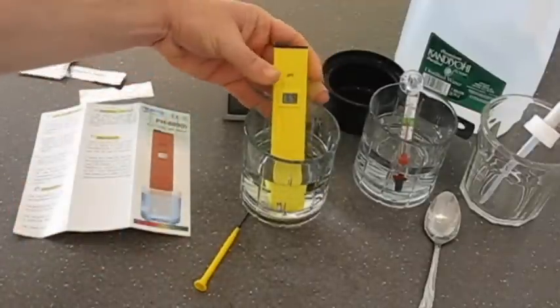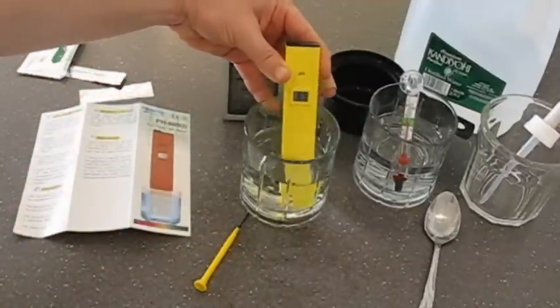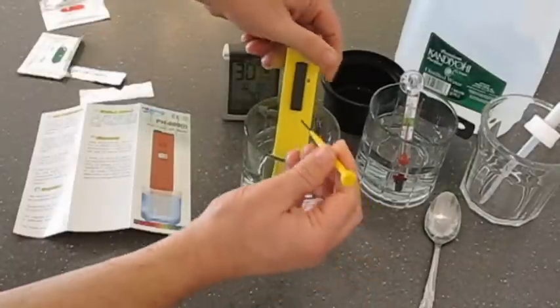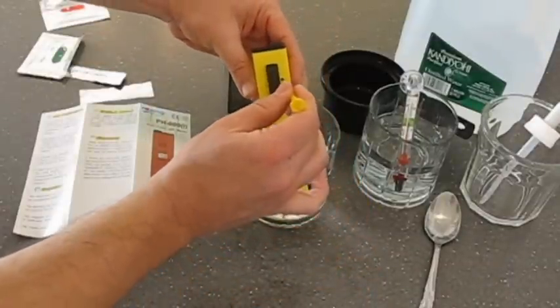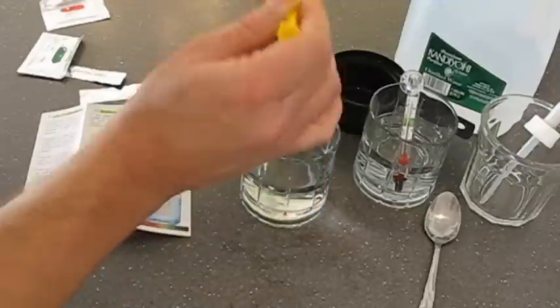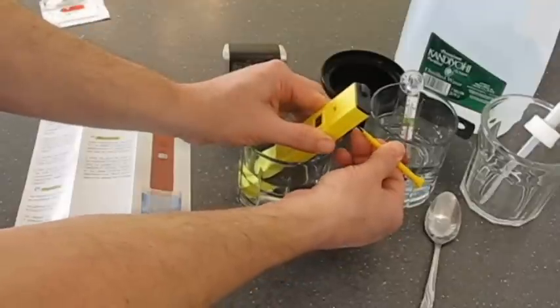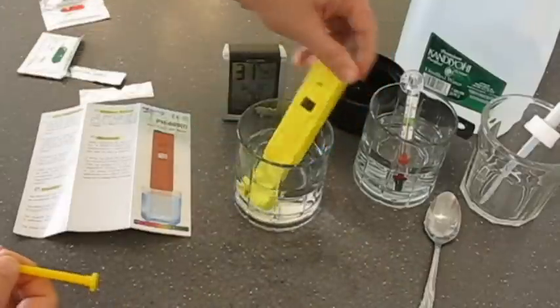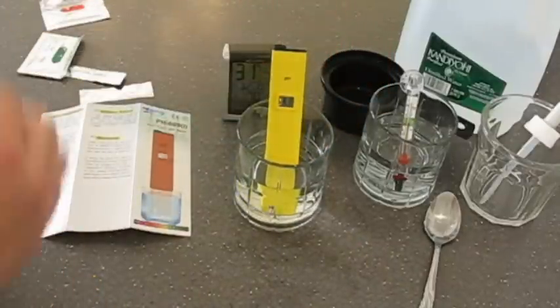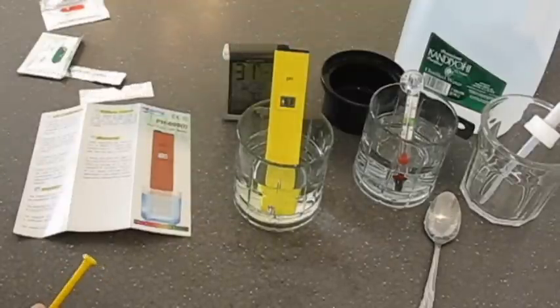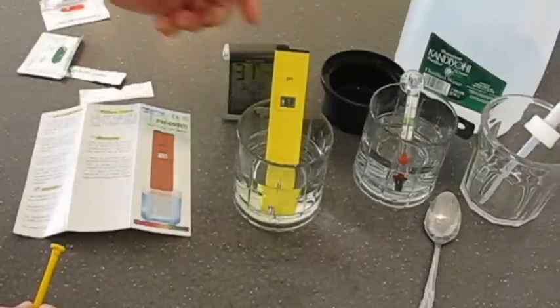And as you can see, this arrived pretty close. It's at 6.5. So to make the adjustment, I'm going to turn this knob back here until it adjusts to 6.86. Alright, so now I read 6.8. I don't know if I should go to 6.9. It doesn't say. 6.86 is really closer to 6.9, but I'll leave it at 6.8, I think.